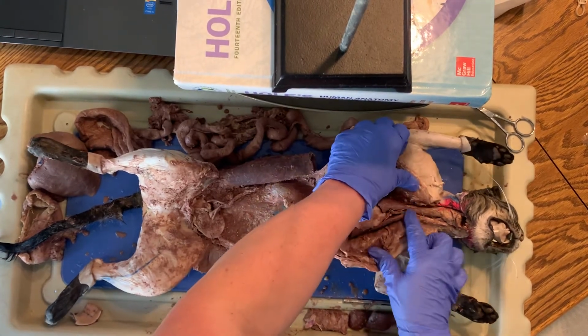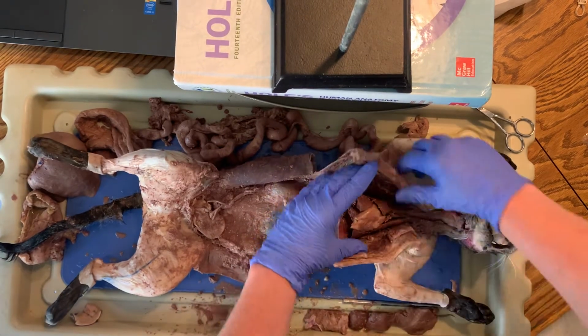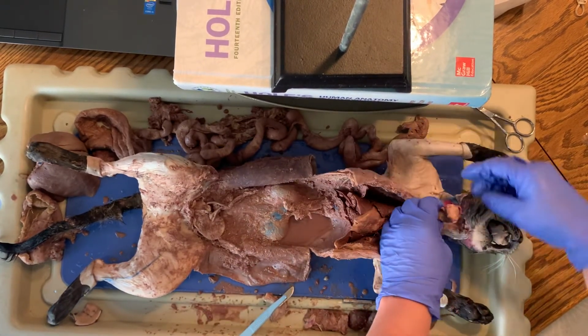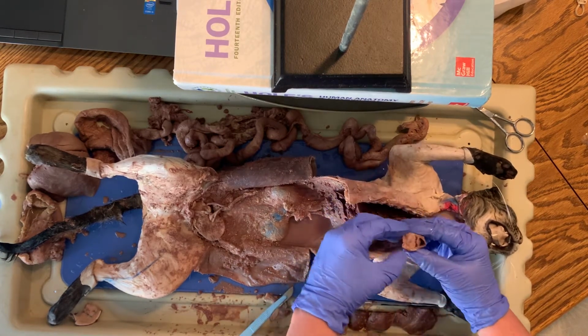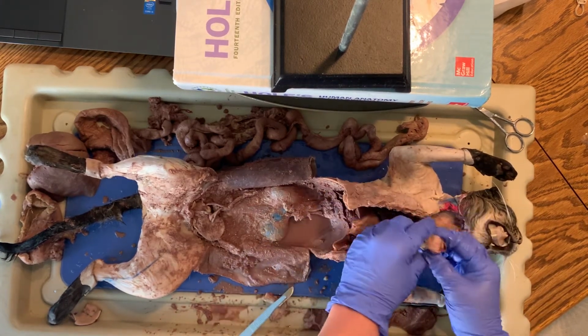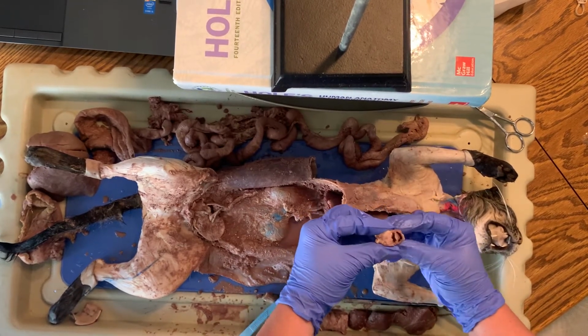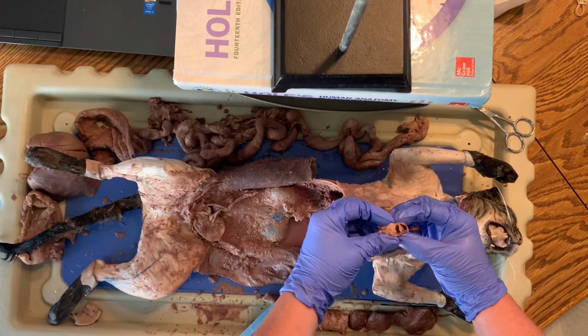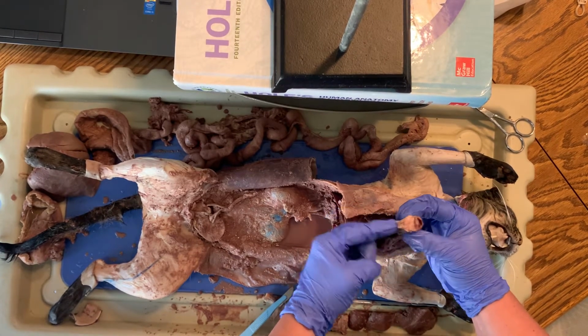And then leading right up here, here is the trachea, leading all the way to its windpipe, its vocal cord. So I cut it off already. And you can see, I hope, yes, that there are two tubes right there. This is how close your esophagus and your trachea are. Your trachea is really close in front of your neck.